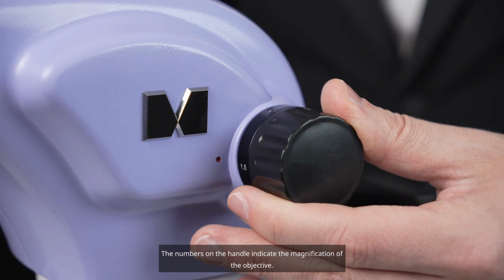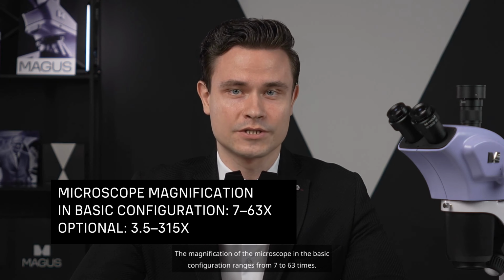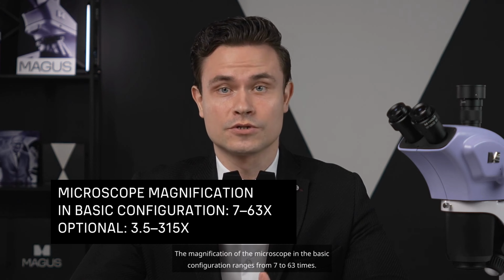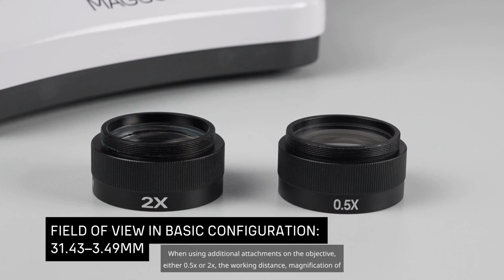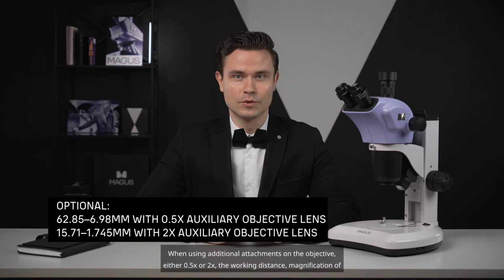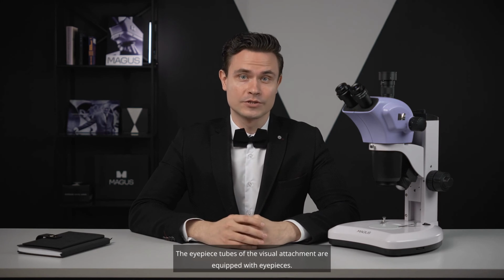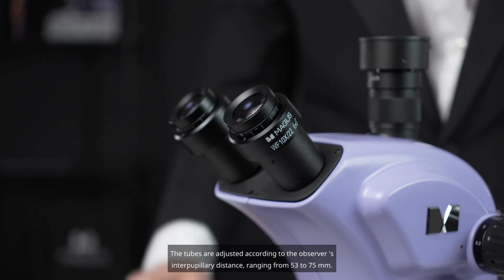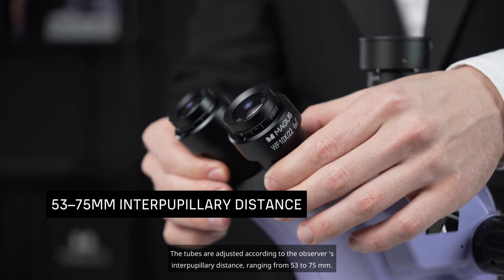The numbers on the handle indicate the magnification of the objective. The magnification of the microscope in the basic configuration ranges from 7 to 63 times. When using additional attachments on the objective, either 0.5x or 2x, the working distance, magnification of the microscope, and field of view are altered. The eyepiece tubes of the visual attachment are equipped with eyepieces. The tubes are adjusted according to the observer's interpupillary distance, ranging from 53 to 75 mm.